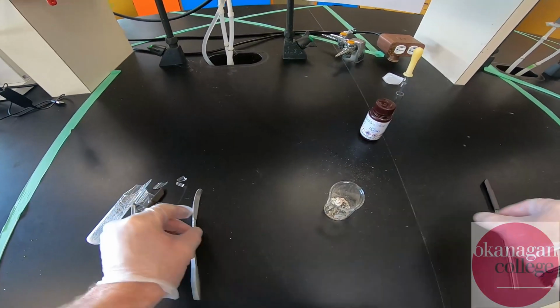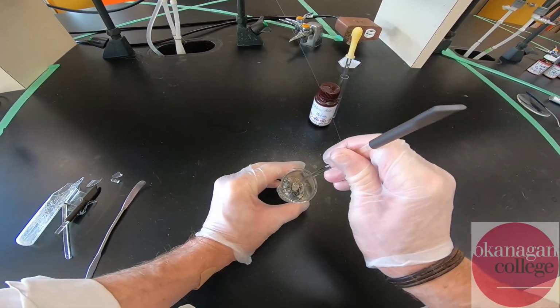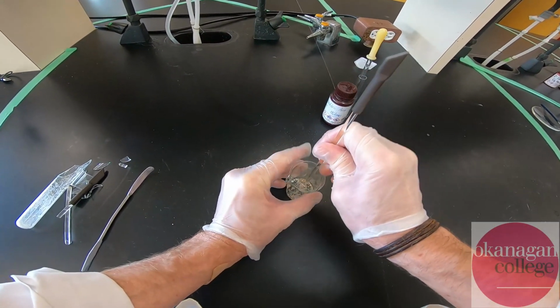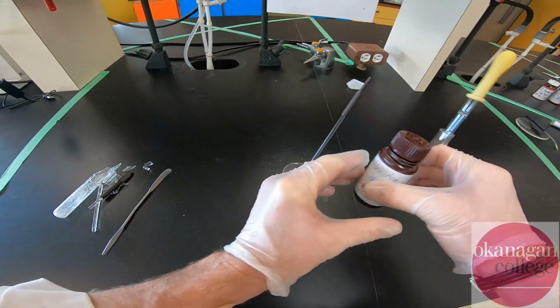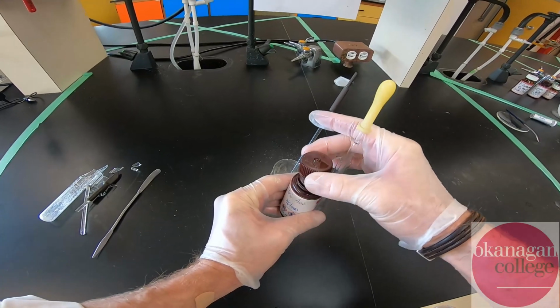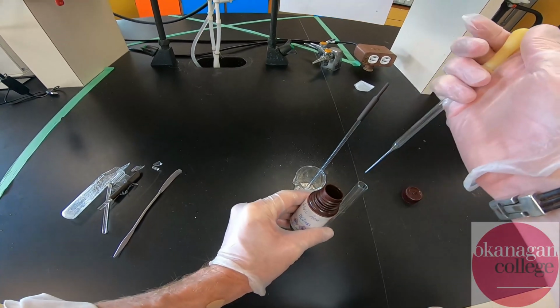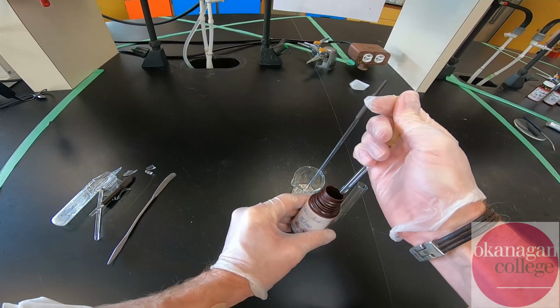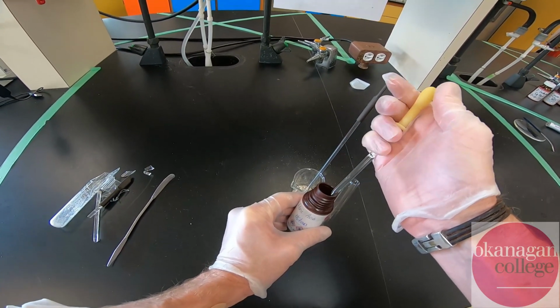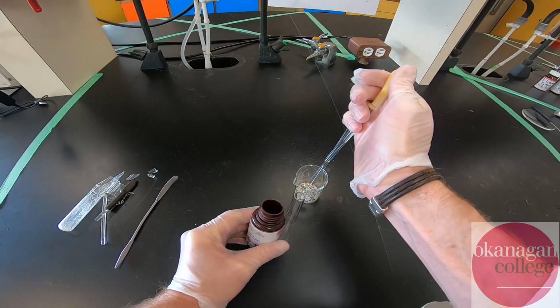So we've done a reasonable job of transferring the material to a beaker. Again, quite solid. Going to be careful here. I'm going to add 2 mils of HCl, and that's going to do the last little bit of reaction. This is not a graduated pipette, but again, we just need enough material to neutralize the sodium hydroxide.